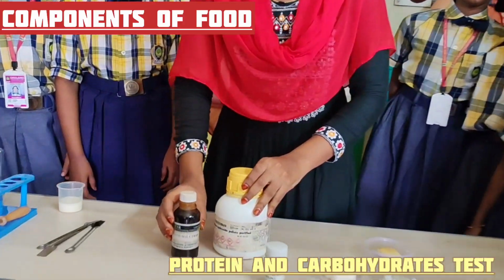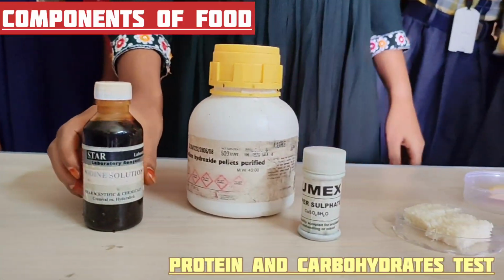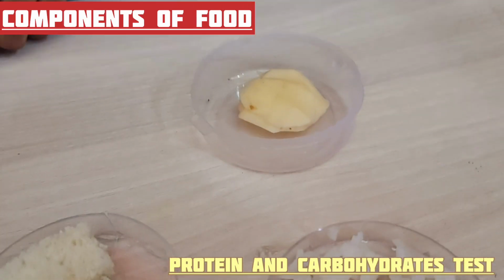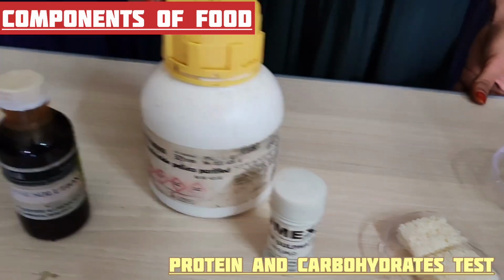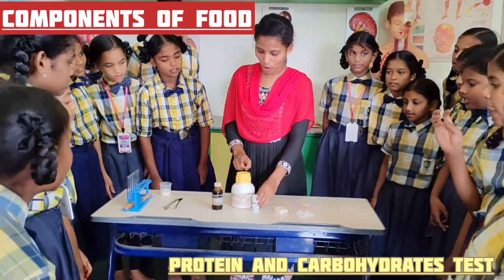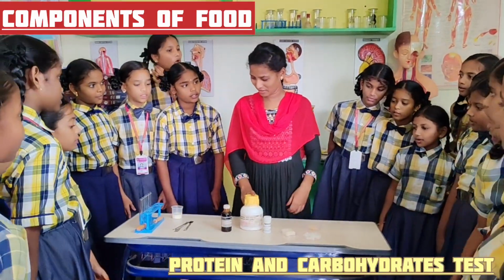Iodine solution. What is the chemical we needed for the carbohydrate test? Iodine solution. What are the chemicals we needed for the protein test? Copper sulfate and sodium hydroxide.